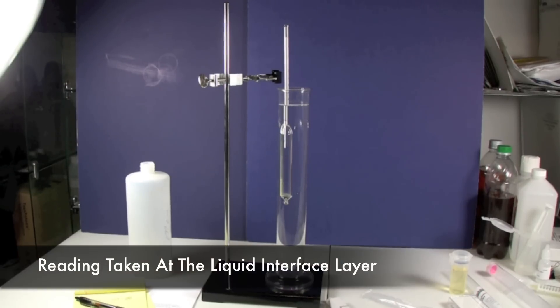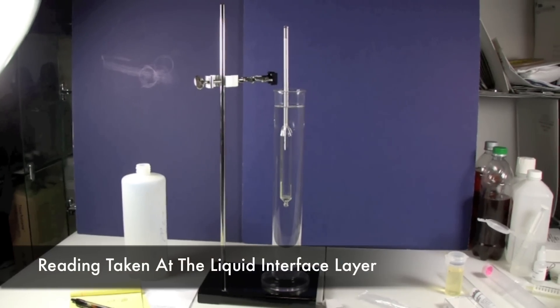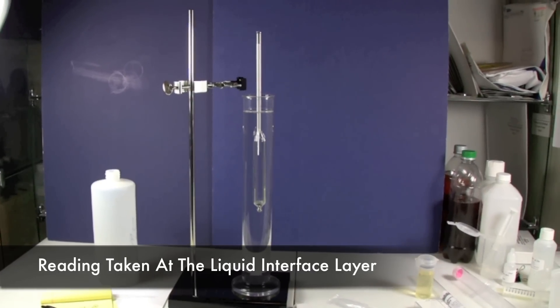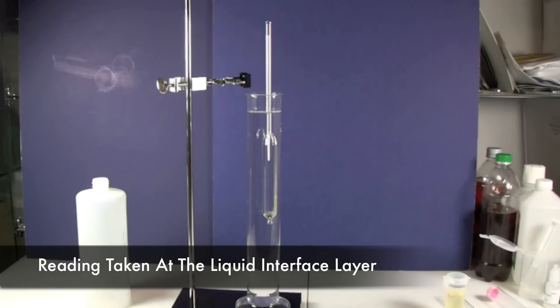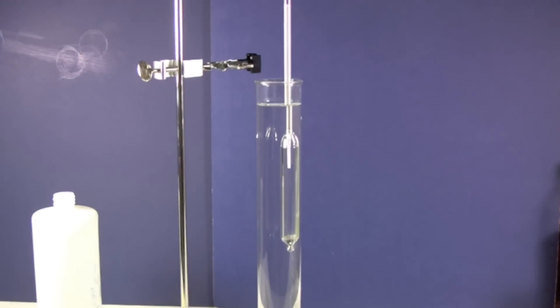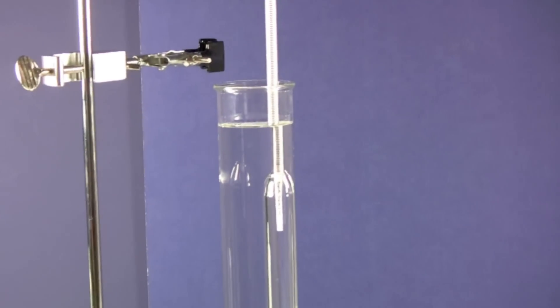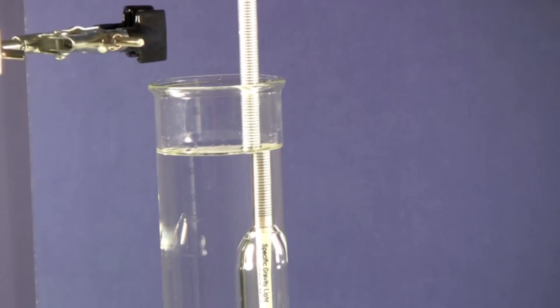The reading will be taken right where the hydrometer interfaces with the liquid, so at the top. So in this case, right here.